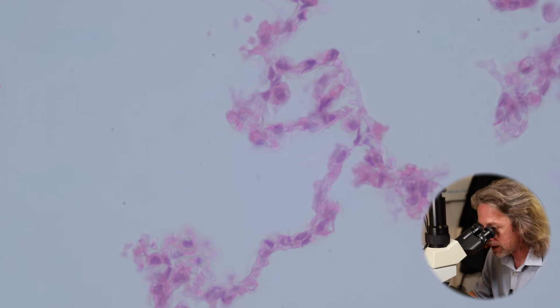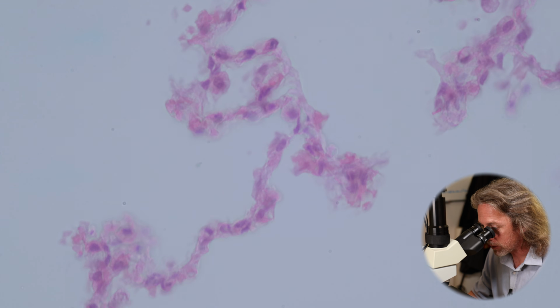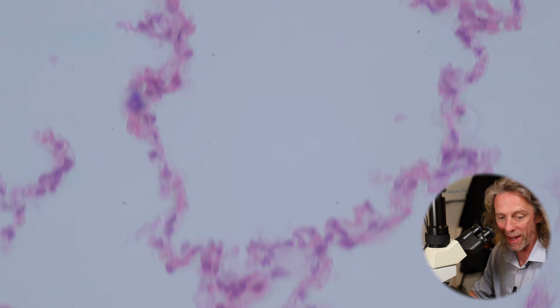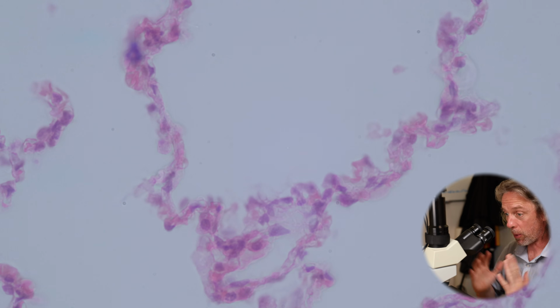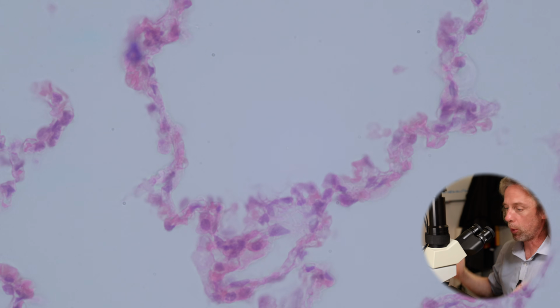So you need these alveoli, these alveolar walls, these alveolar surfaces to be moist, to be wet. The gas that we inhale needs to dissolve into water, so we need to have a wet surface in here. That's also protecting these cells, this very thin surface of cells. But when you breathed out, there was a risk of these very thin walls sticking together, and there'd be quite a big effort to pull them apart again.